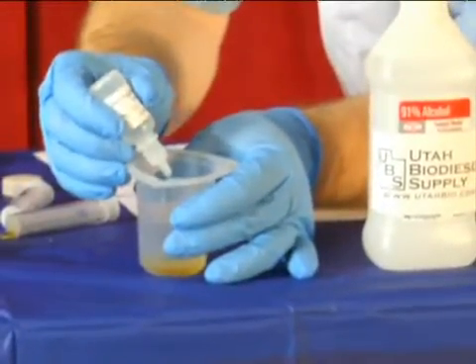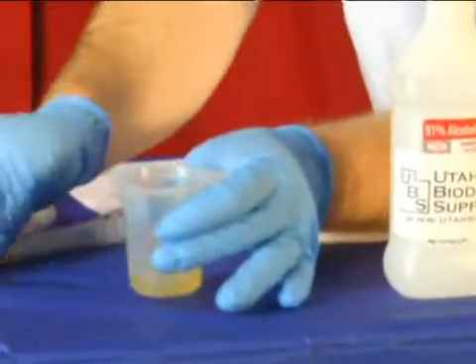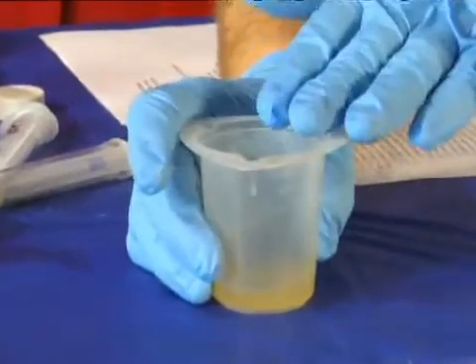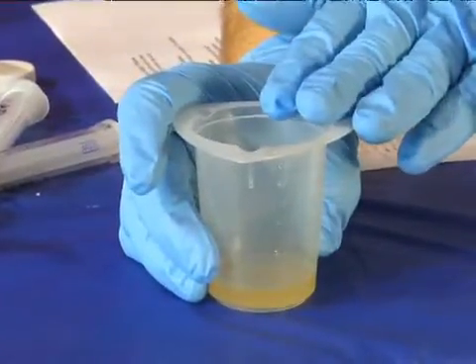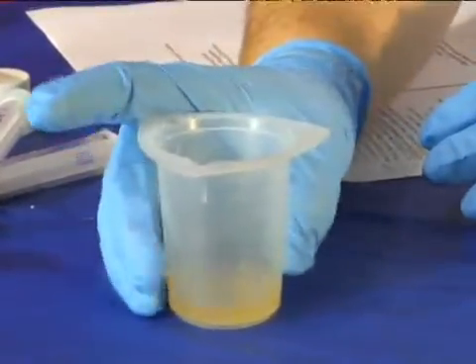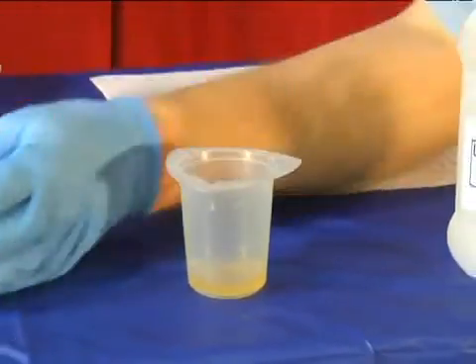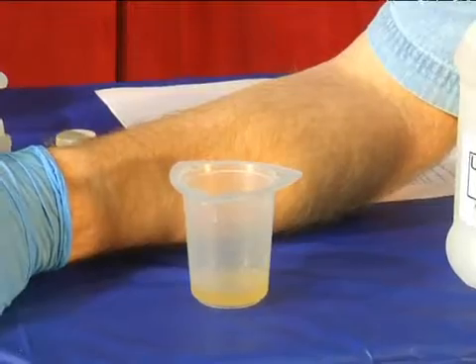1, 2, 3, 4 drops, and then I want to stir this up really, really well, so I'm just going to swirl that around for a little bit. This is my unknown acid solution — I've got oil and I don't know what its acid content is. I'm now going to take and suck up some titration solution that I made earlier.